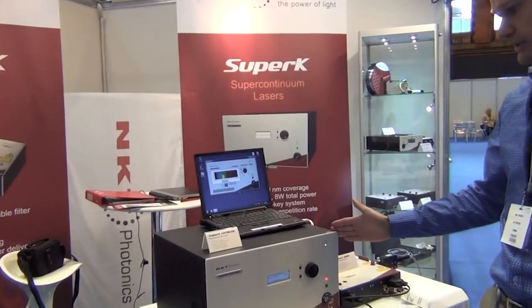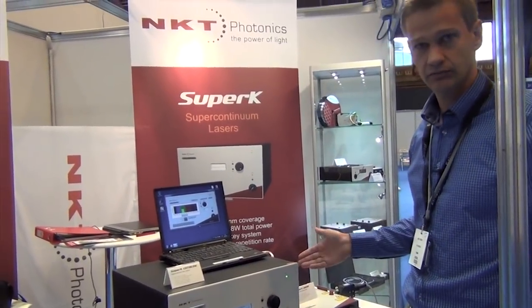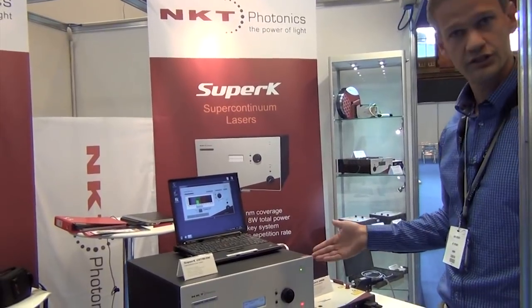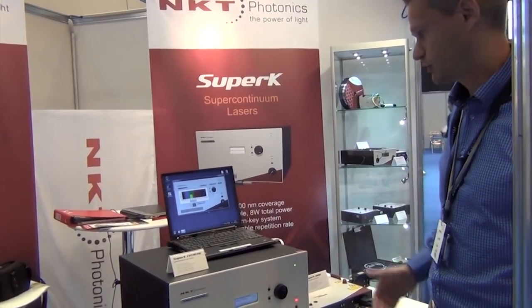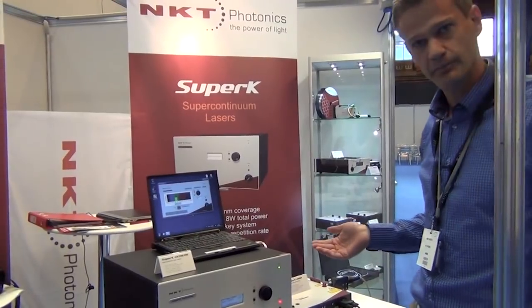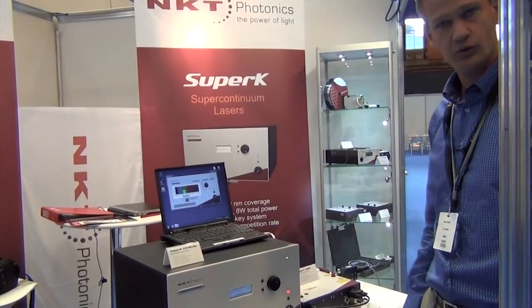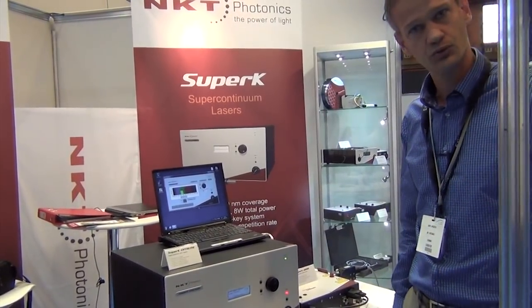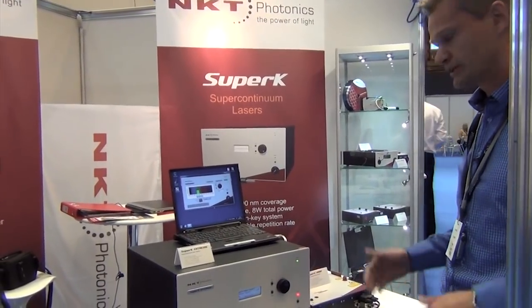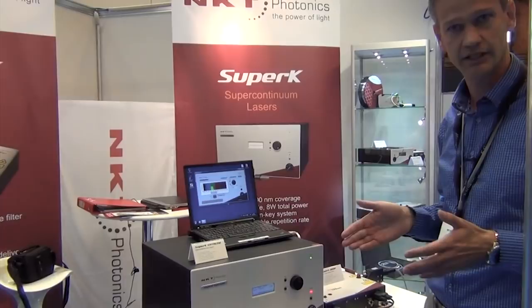This is the model we typically produce for imaging applications like fluorescence microscopy and OCT applications as well. The total average power — integrated across the whole white light range — is from about 2 watts to 8 watts of output power, with about 25% within the visible range of the Super-K spectrum.